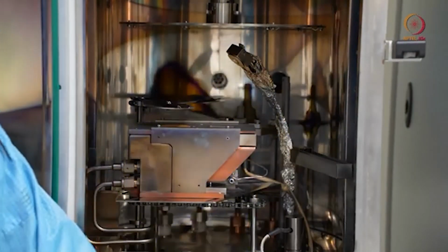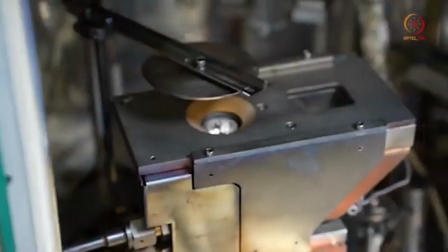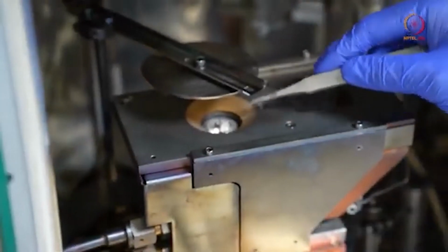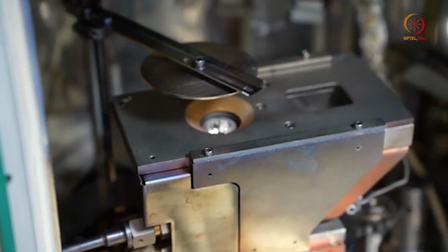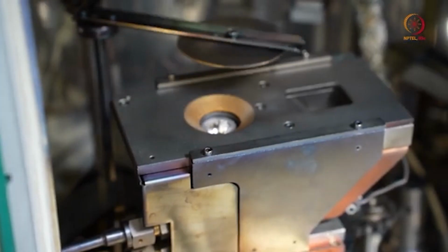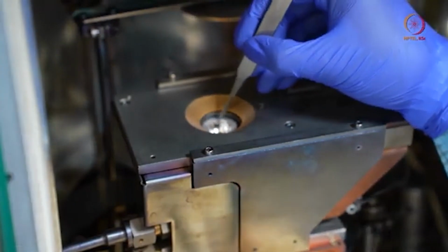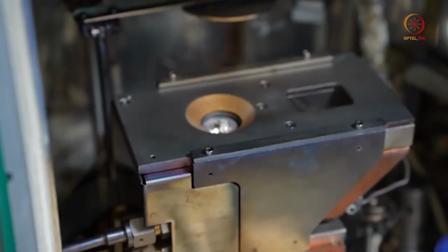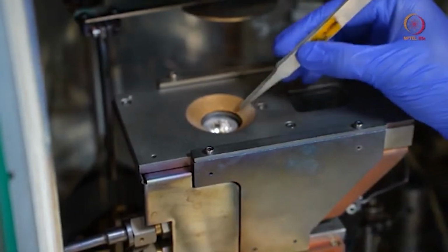Before that, let us come closer to see the crucible. To get access to these crucibles we have to open the shutter first. So let us remove the shutter. Here you can see one of the materials. As I already mentioned, there are 4 crucibles. Let us check what all 4 crucibles are.